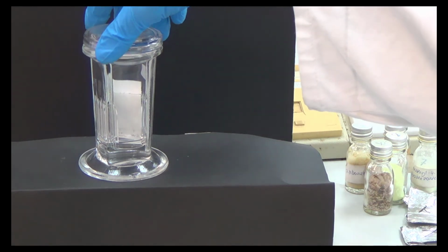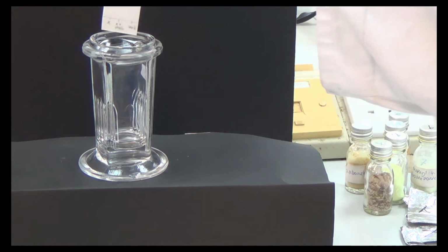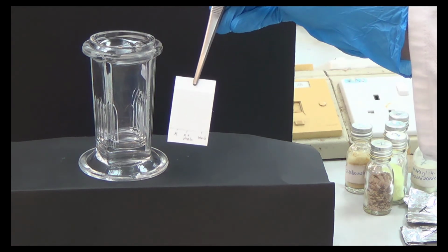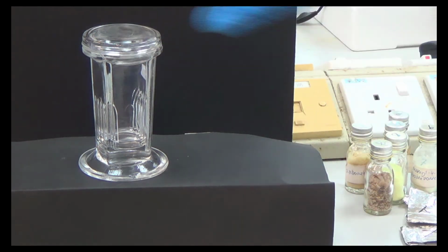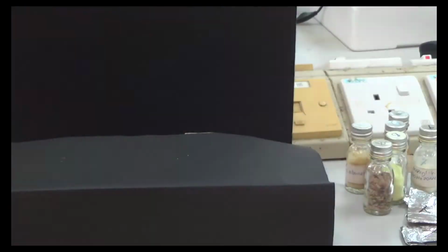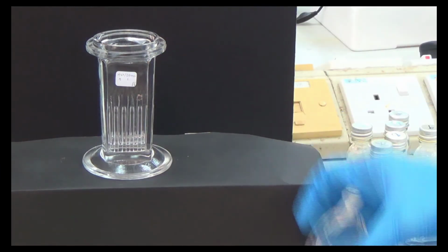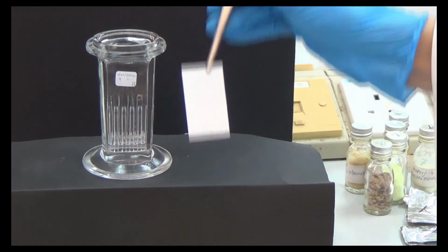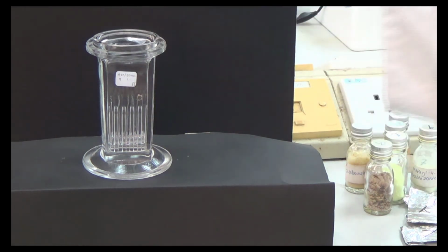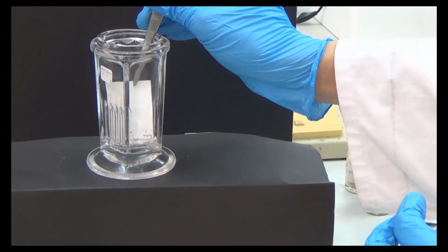So this is already done. I need to take it first before I forget. So we're done with the X. Let me dry this first. We dry. Okay, now we're done with the X. Remember, we have also Y. So we remove this, put it somewhere, and then we have another one, this is for Y. We open it and put the Y. Let me take it first. Okay, so this is Y, one of the Y compounds that we did before. So we put it inside, because this is easy to see here. We put it here. Okay.